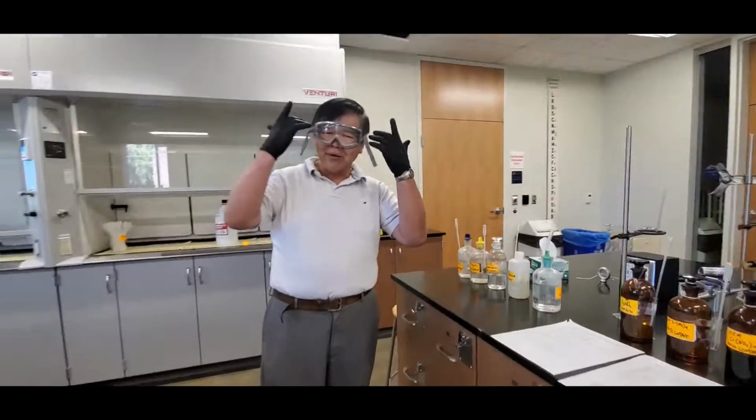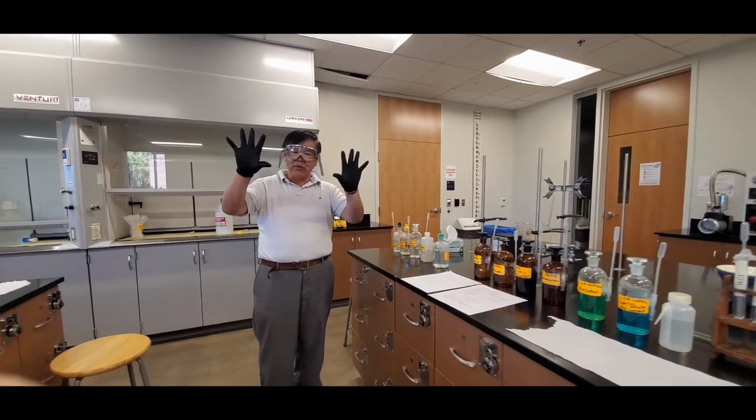Now all of this is rather corrosive. That's why you see me wearing goggles as well as gloves, okay? That's very important as usual.